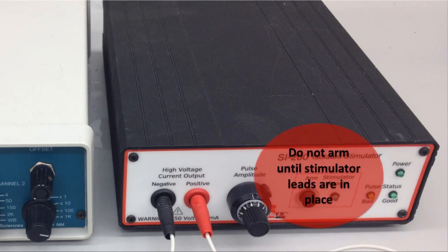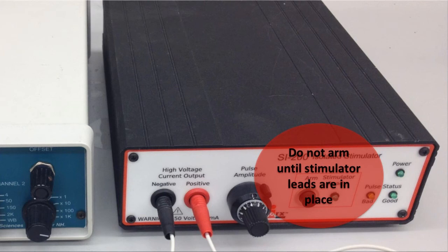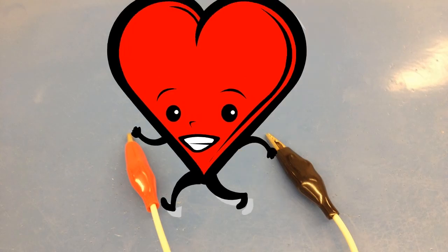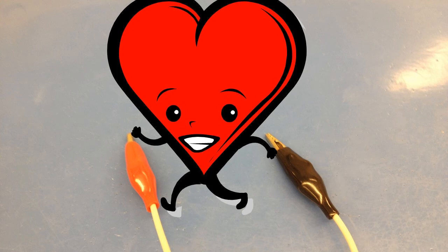We'll have to arm the stimulator, but first a little bit about safety: make sure you never touch both ends of the stimulator leads across your heart.